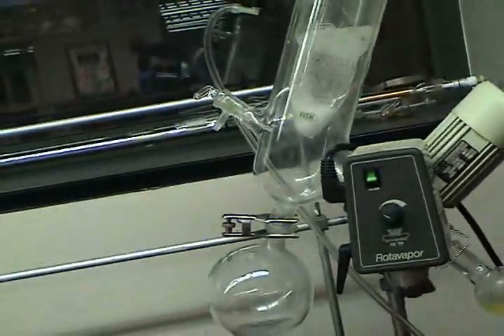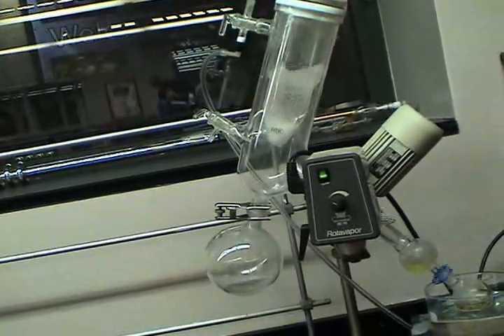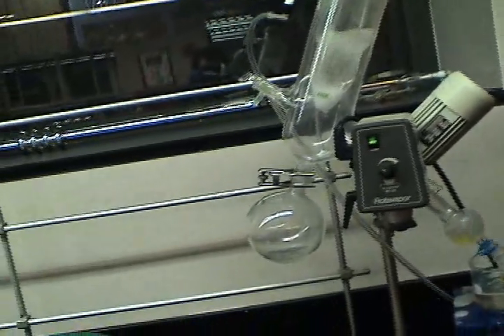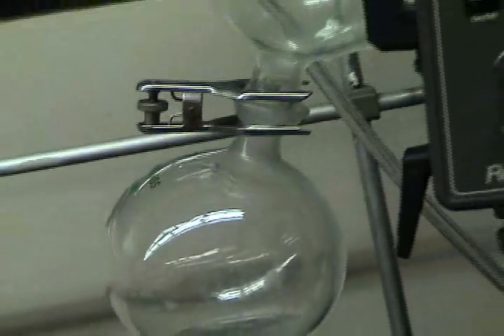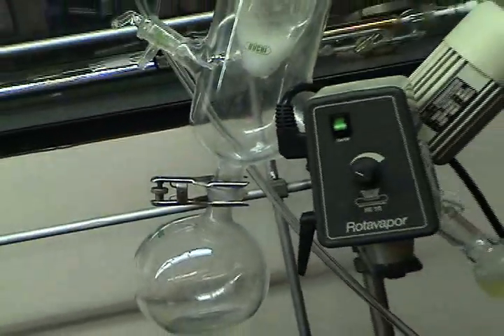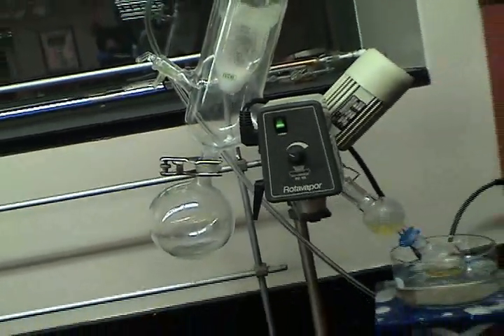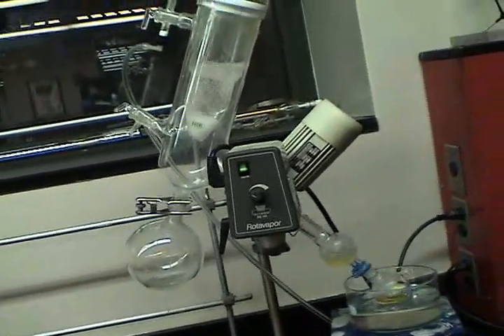We can also see our cold finger, hard at work. We see the solvent collecting on it, and dripping down into the waste trap. Let's speed up a few minutes.